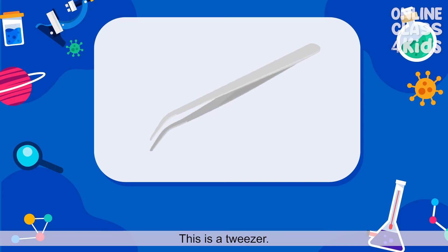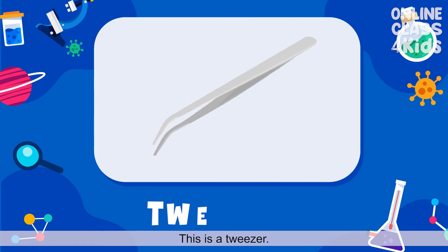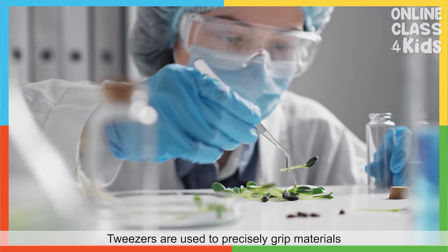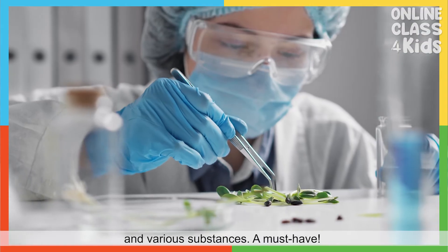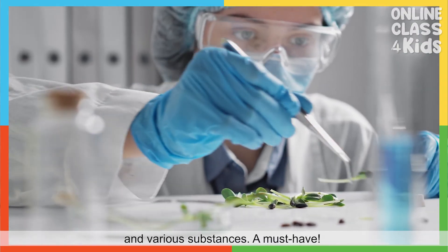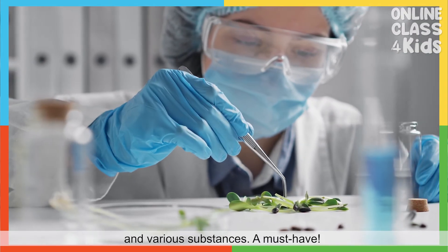This is a tweezers. Tweezers are used to precisely grip materials and various substances. A must-have.